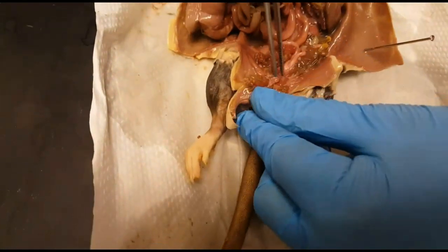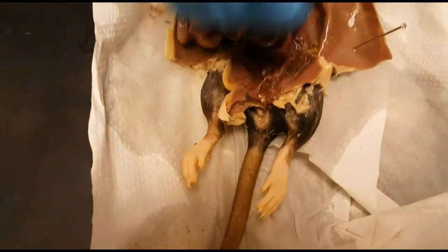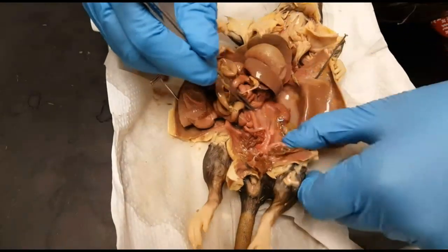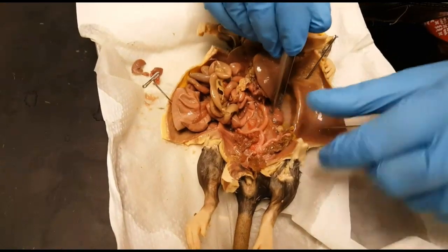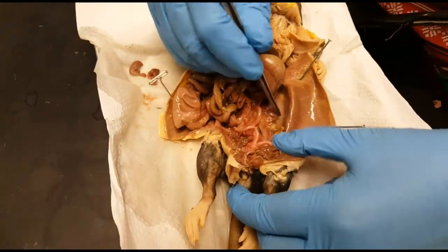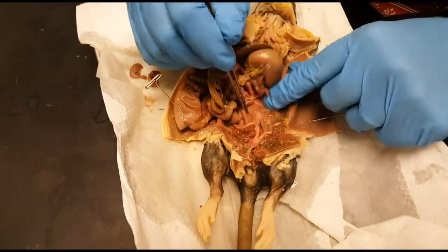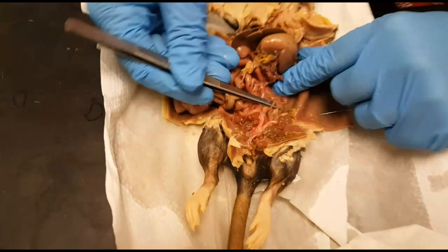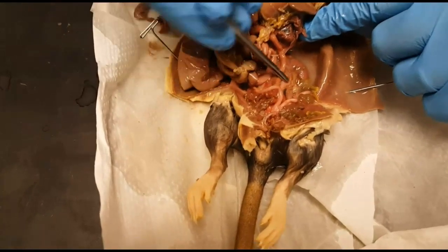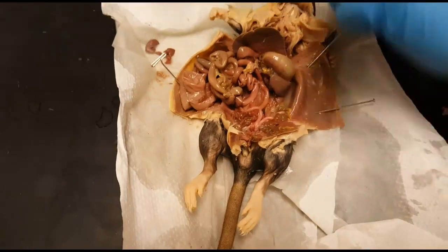Down at the bottom we can see a little piece of tissue right here — this is the urinary bladder. If we find the kidneys, which are retroperitoneal organs sitting in the back that look like kidney beans, you'll typically find a ureter connecting the kidney to the bladder. Here it is — it's really tiny — this is the ureter connecting the bladder to the kidneys.